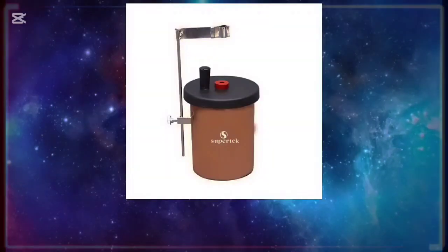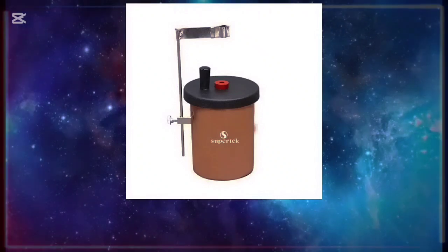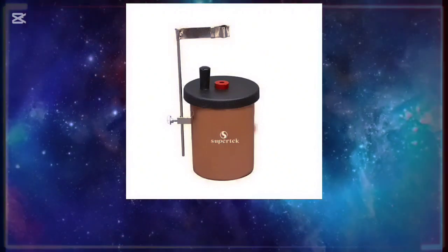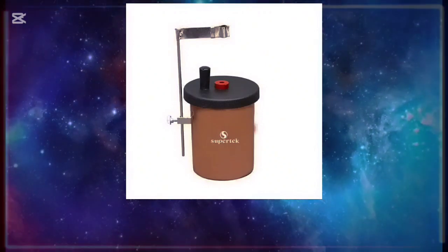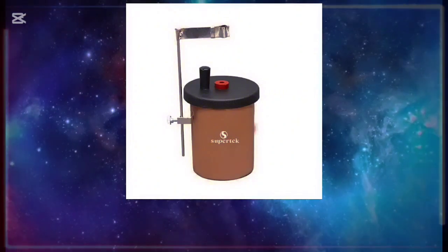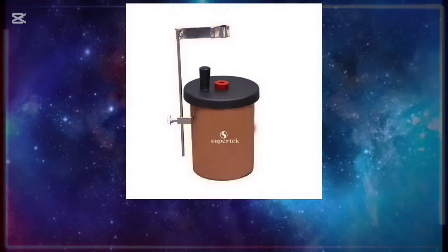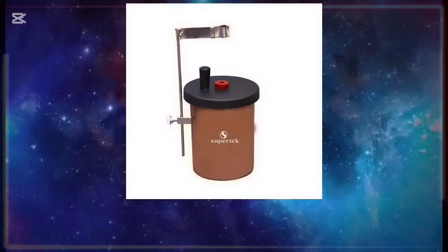The calorimeter usually contains a stable liquid that makes good thermal contact with the process once the solute is being dissolved, during the experiment.